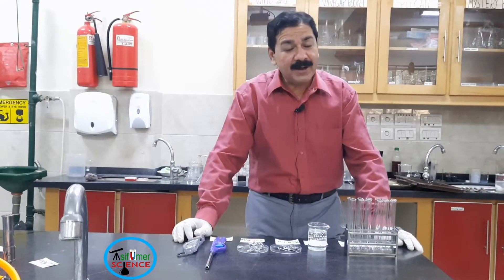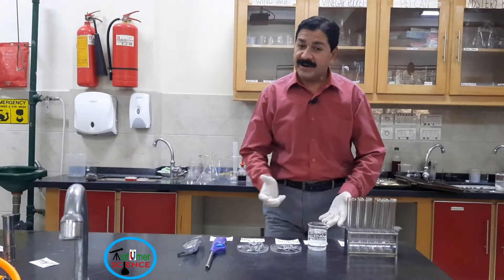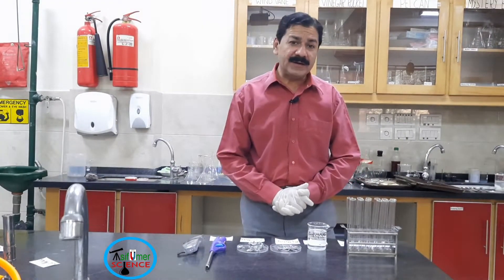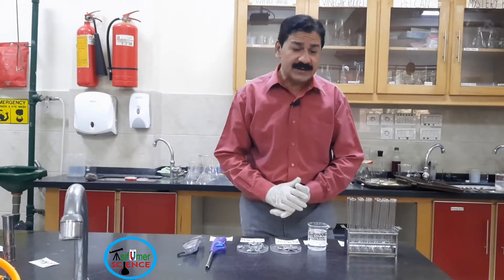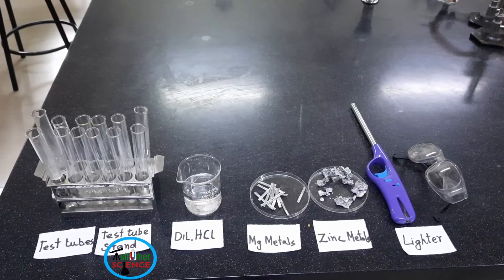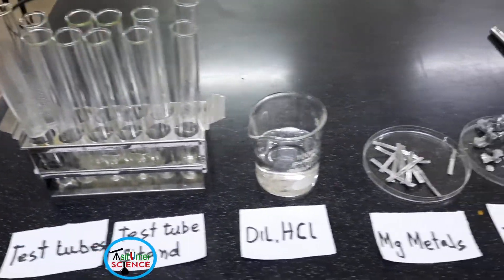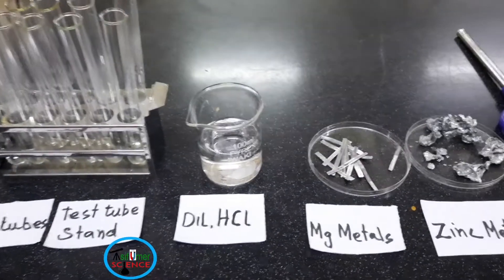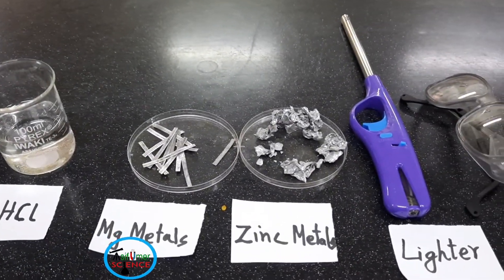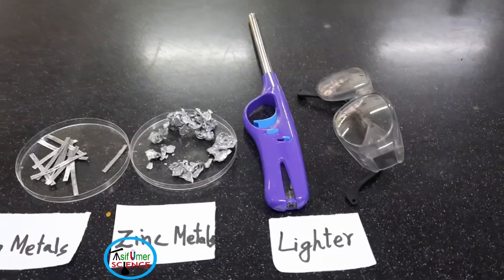I am Asif Umar and our today's activity is reacting metals with acid. In this activity we are going to make hydrogen gas. For this activity the required things are: test tube, test tube stand, dilute HCl, magnesium metal, zinc metal, lighter, and safety goggles.